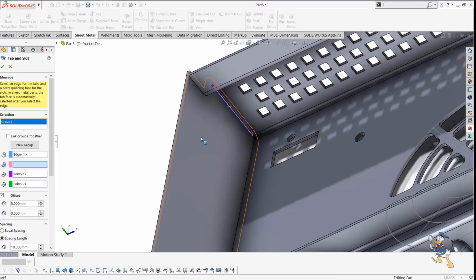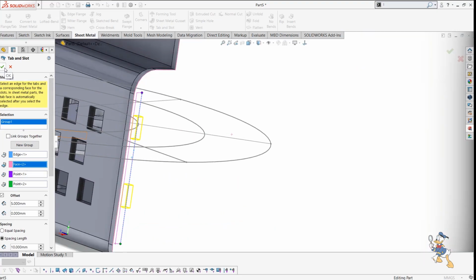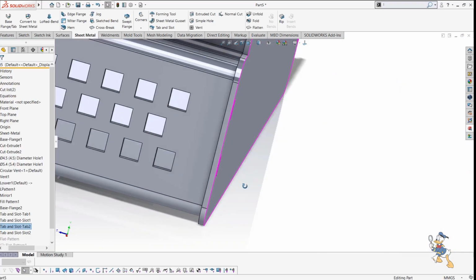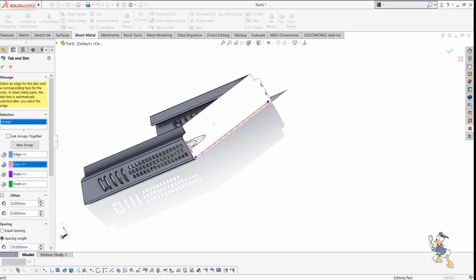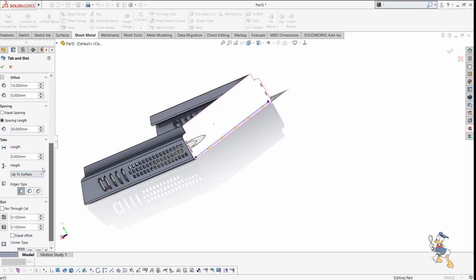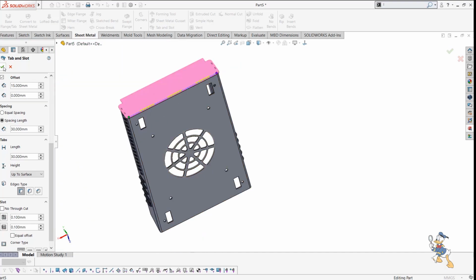I just need to generate tab slots over here as well. I select the line and face, and by enhancing previous features, I check it over here, and it automatically generates tabs and slots. I also need to generate some tab slots over here, so I select the edge and the face, and suppose I need an offset value of 15 and a total distance of 30, or it is required 60 or something like 30, or I just generate like 3 tabs and slots over here.